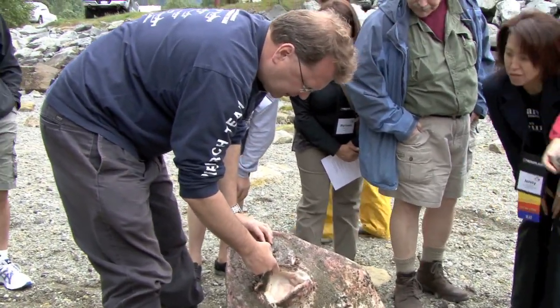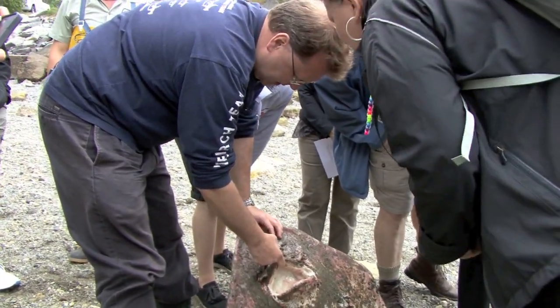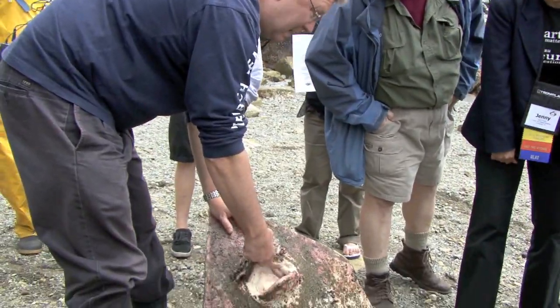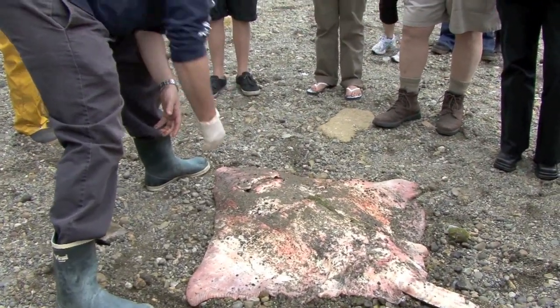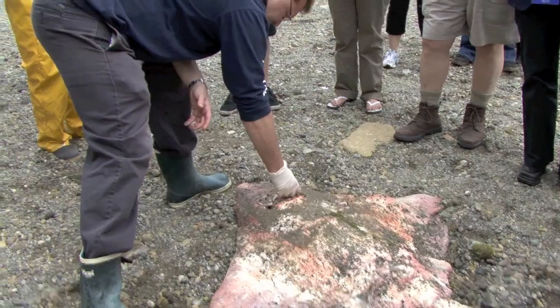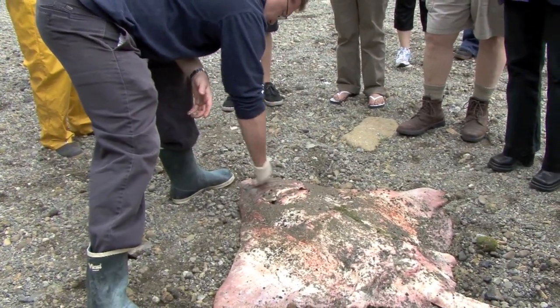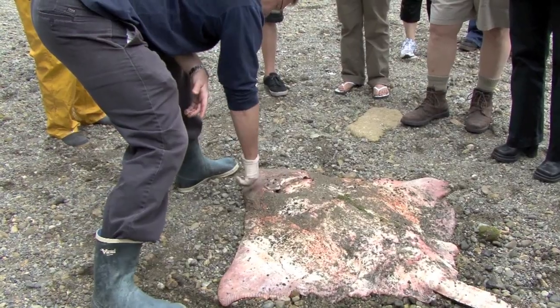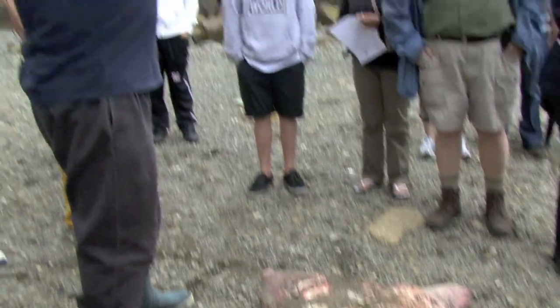Look inside the mouth there — see those little white things that look like tadpoles? Those are copepods. They're parasites, all over the pharynx in there. The tag site looks a bit infected and inflamed, so it may be septicemia. They can scrape food off rocks, and you also see these little appendages on the end here — these are sensory. They also have things called ampullae of Lorenzini all over the nose. All the little black dots that aren't sand are actually electroreceptors. These guys basically swim over the bottom and detect things buried in or flat on the bottom.